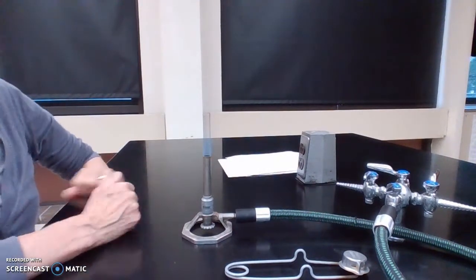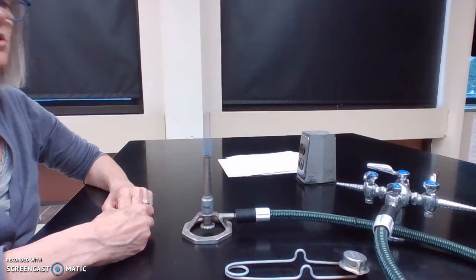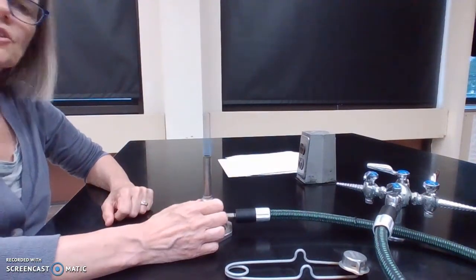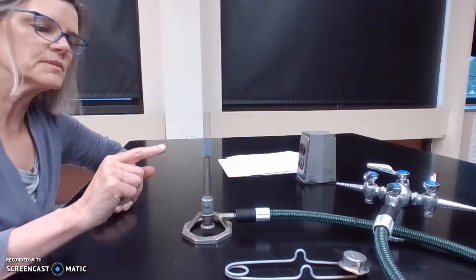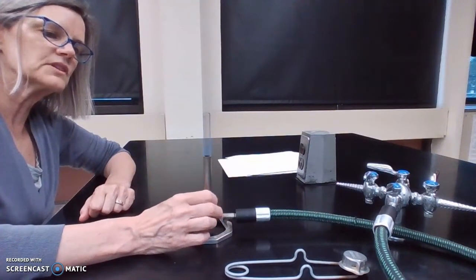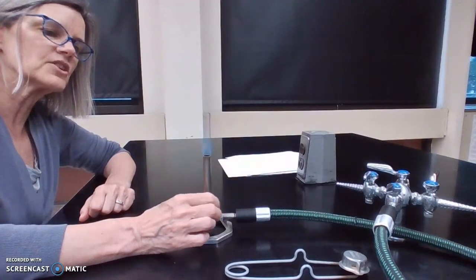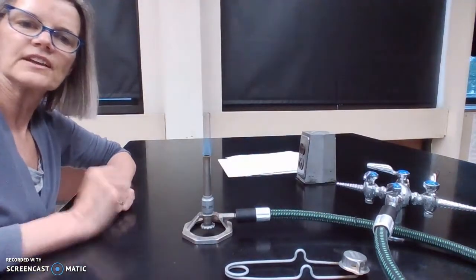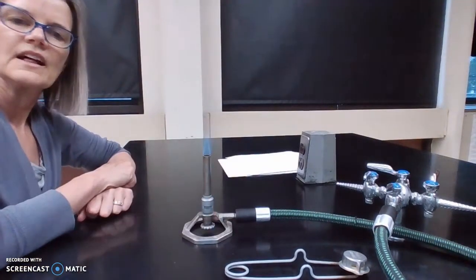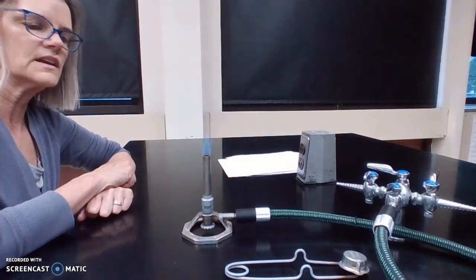The other thing is the quality of the flame has some bearing on how quickly it's going to do its job. And so we want a nice hot flame. You might have noticed this in the past, but with Bunsen burners, when you have a flame like this, we're trying to get this really nice cone of colored cone in the center of the flame. And I think you can see that in the video, that I have kind of a colored cone there. That cone area is the hottest part of the flame. So I want a nice cone.